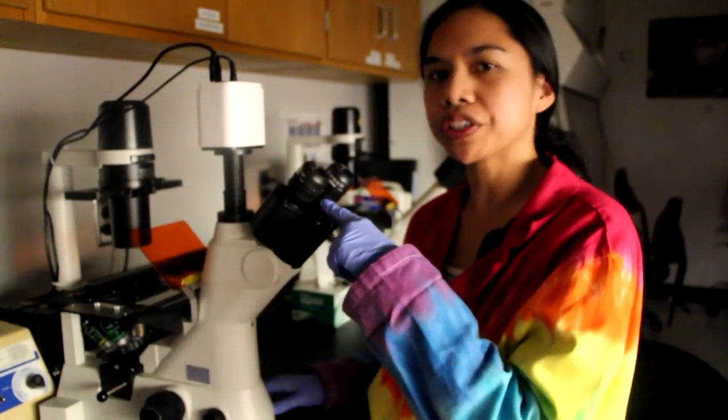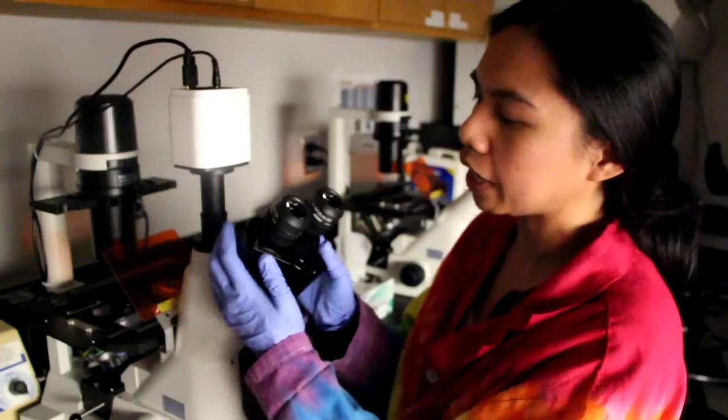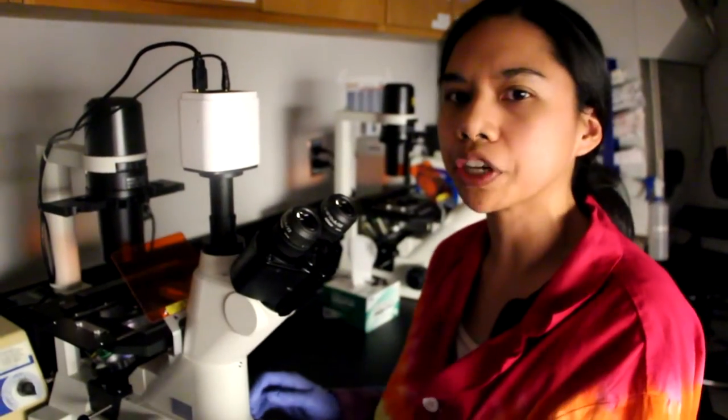Next is the eyepiece, which is where you look through the microscope in order to see your samples. And this eyepiece is adjustable so that you can make it comfortable for you.